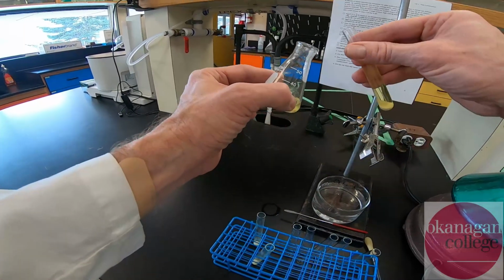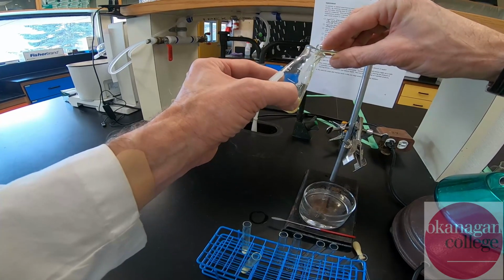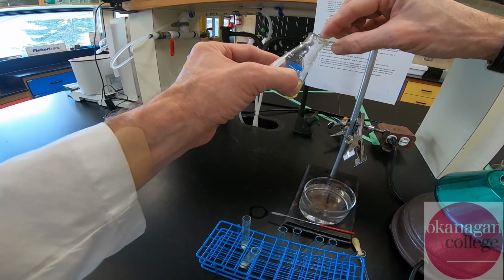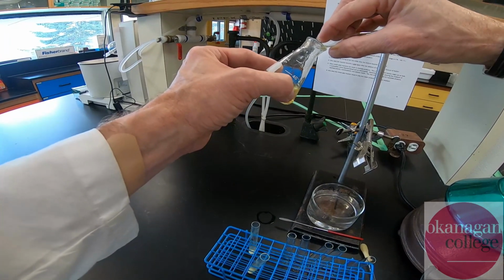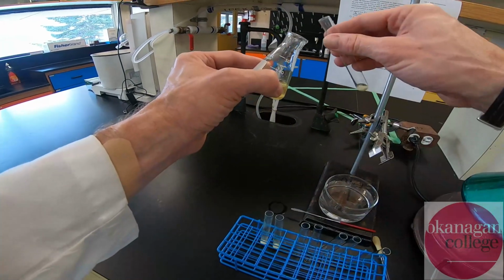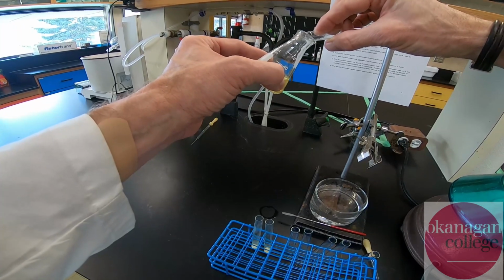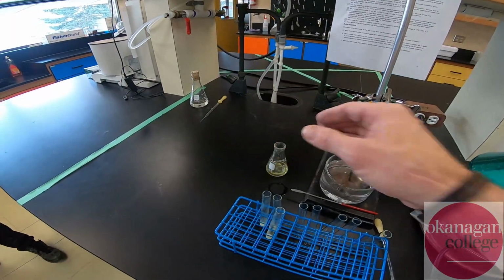So that points to the fact that you always do lose material with recrystallization. But by comparing our crude material versus our purified material, we'll see if the effort was worthwhile. If we get a pure product, great. We expect a small loss of material. However, if the purity of the crude material is similar to the recrystallized material, we are really just doing extra work for no added benefit. And that's the reason why we take the crude melting point and then a purified melting point. So in future, we know if our efforts were required or done in vain.